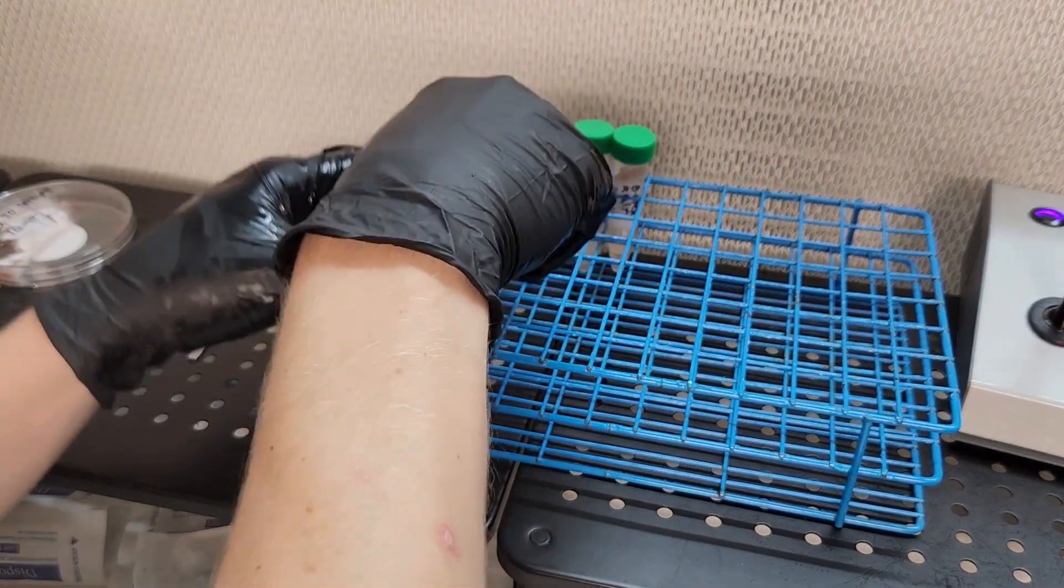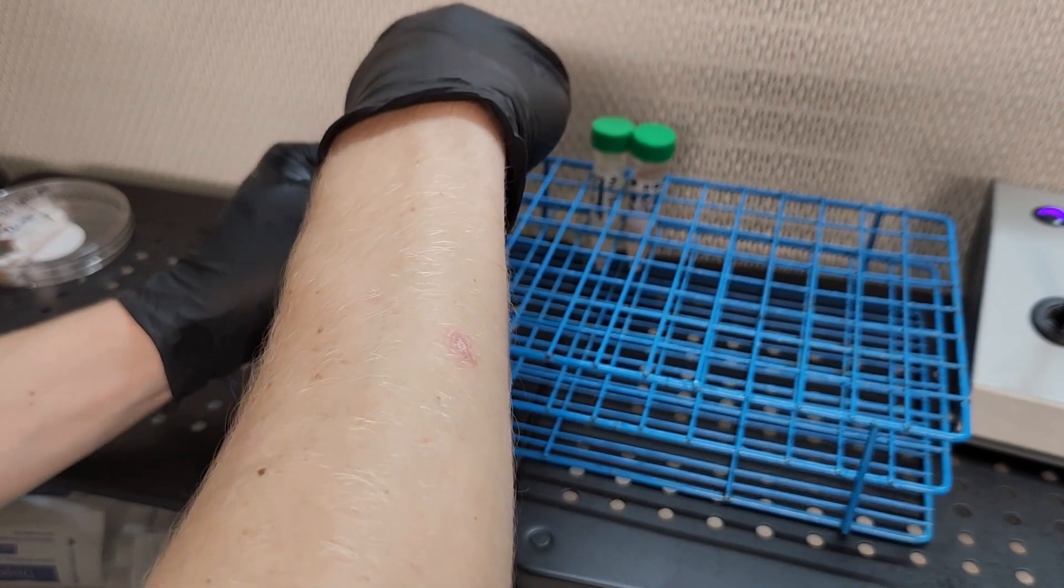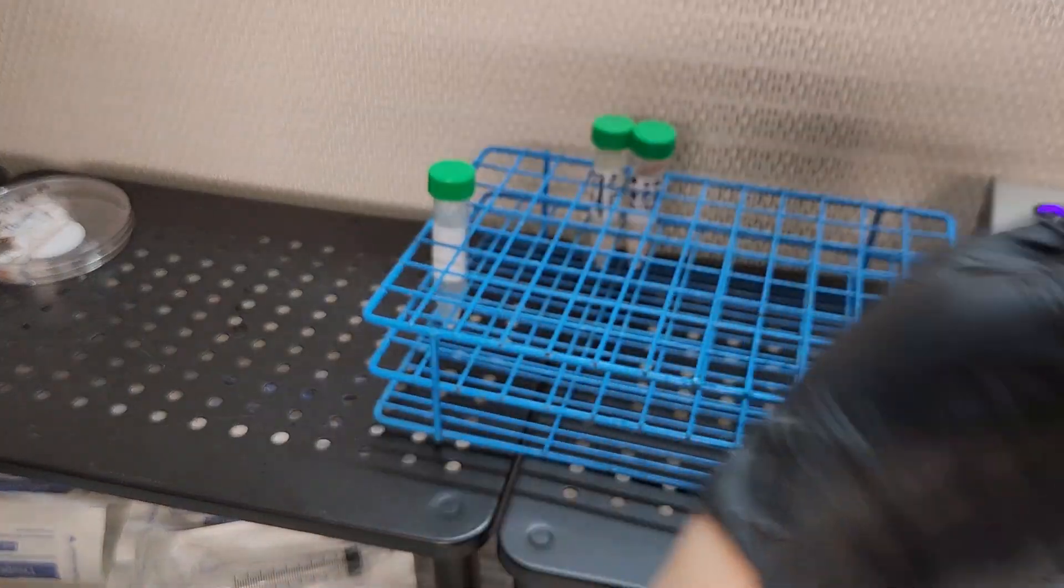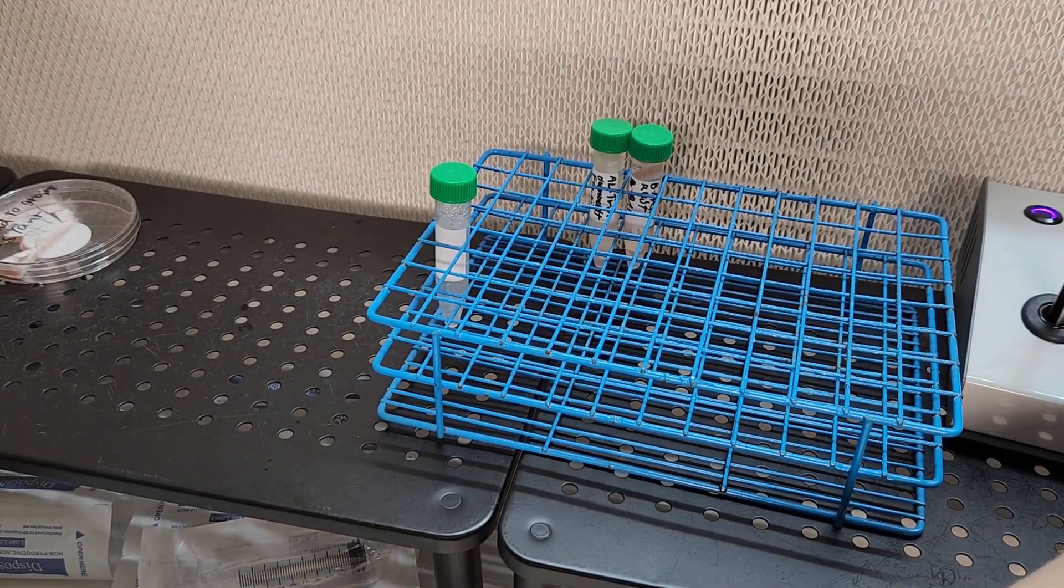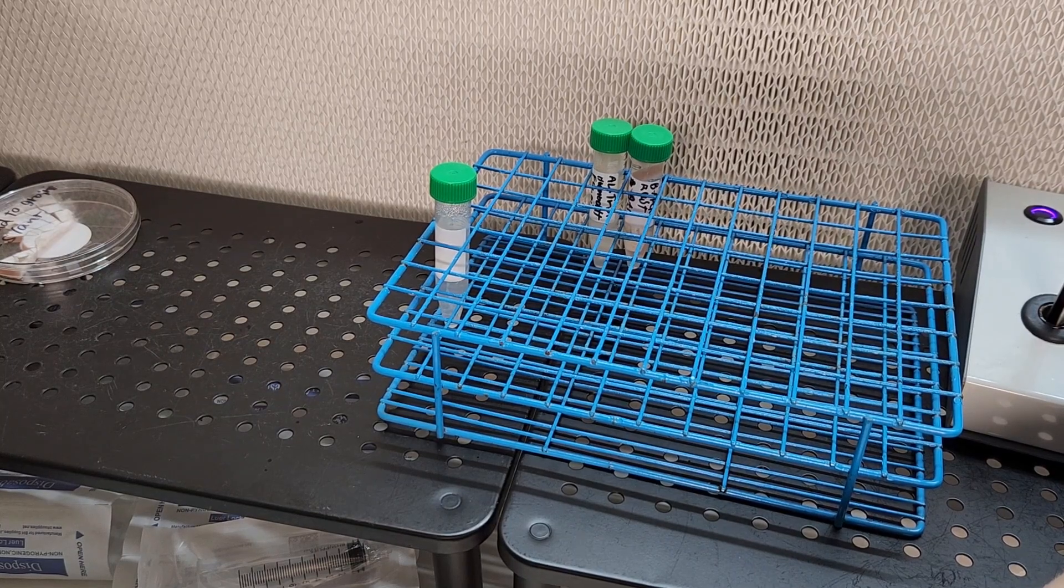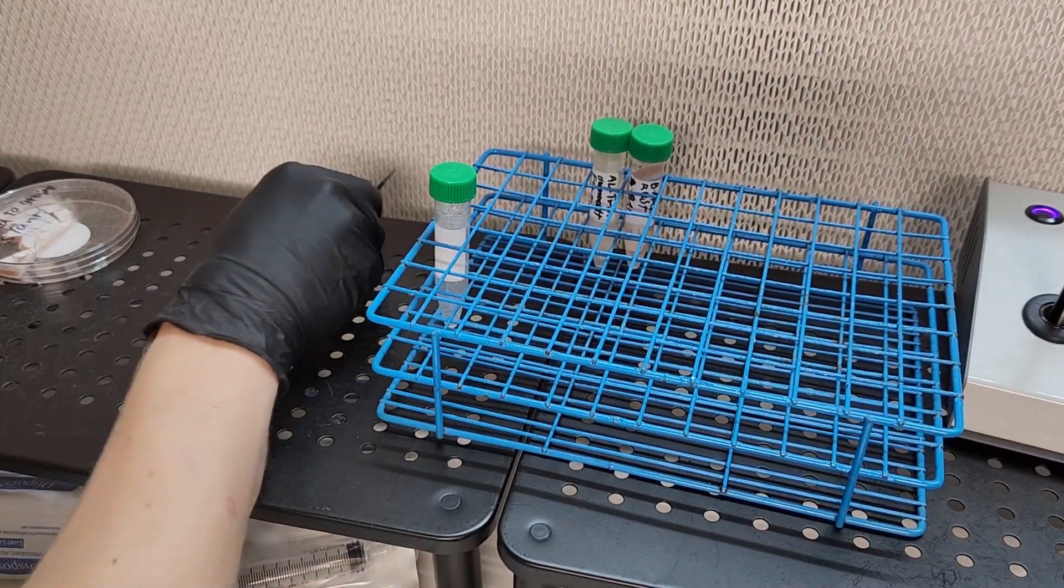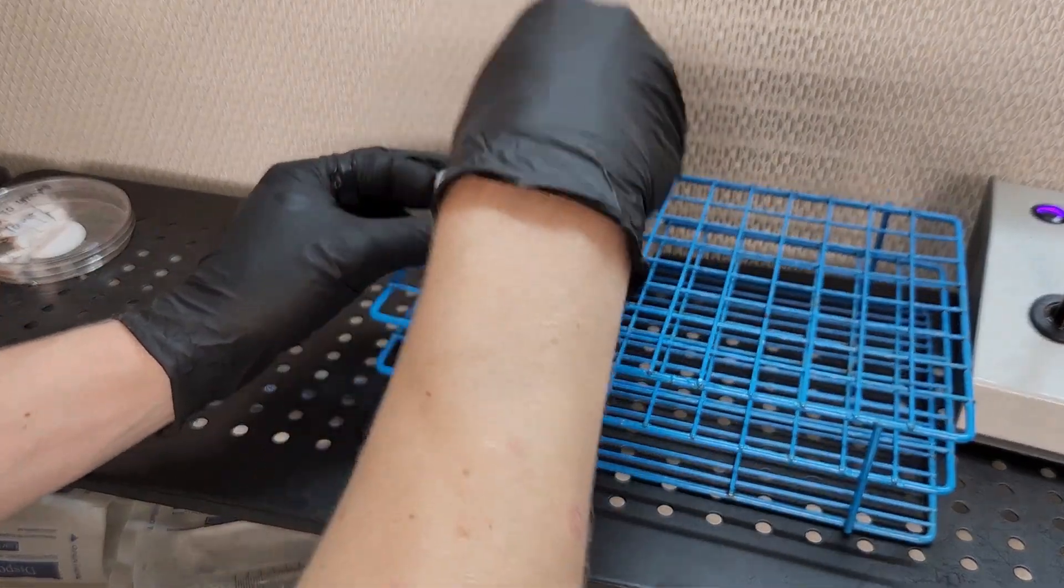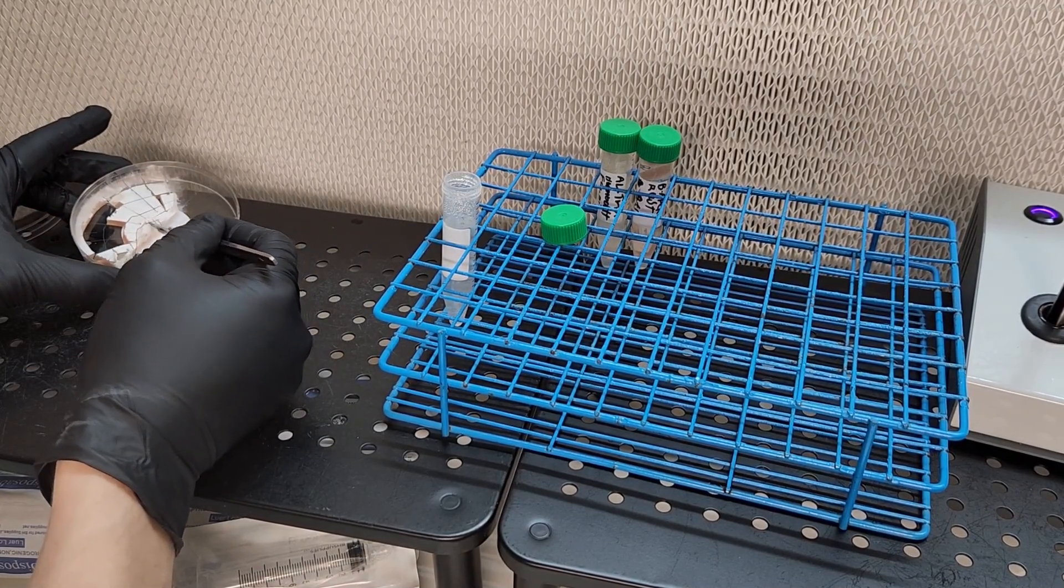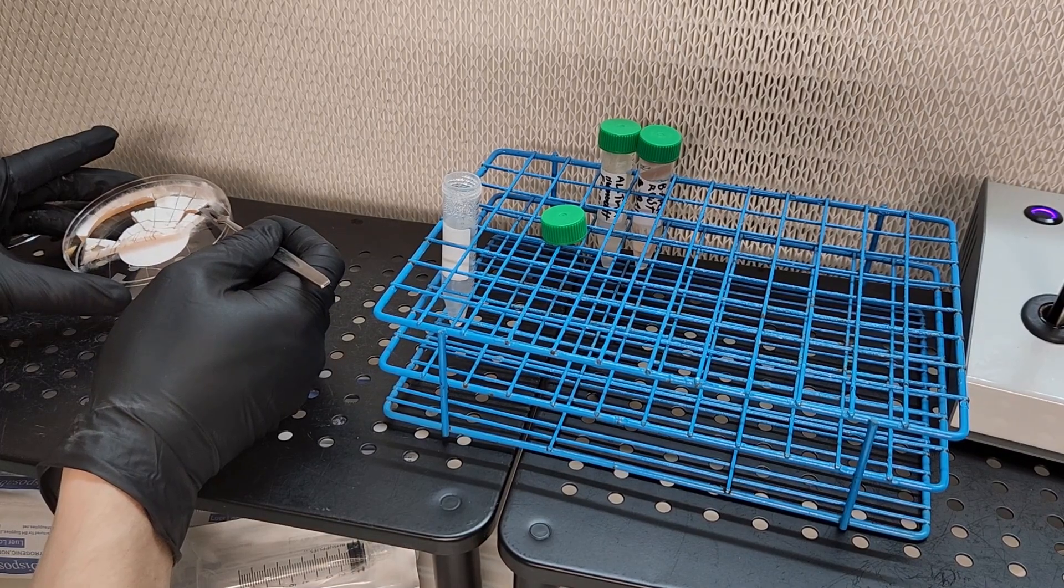Today we're going to talk about long-term storage of your mycelium cultures. Regardless of what mycelium you wish to preserve, it is wise to preserve it in a slant. But unlike traditional slants, these slants are just distilled water and contain no media. This way of storing slants is very convenient, easy to do, and can store a lot more transfers than a traditional slant.